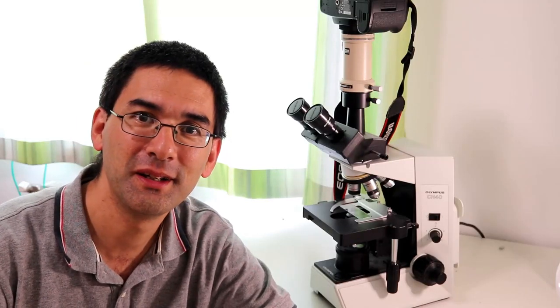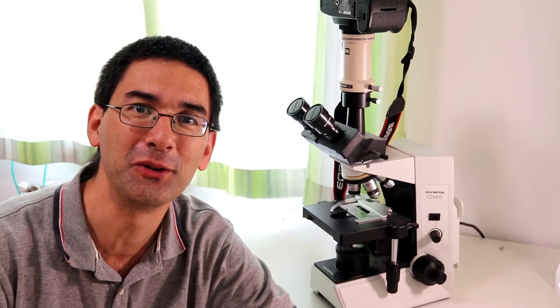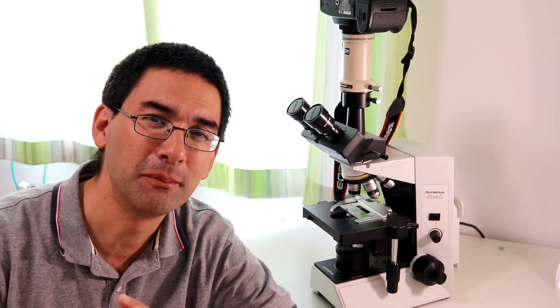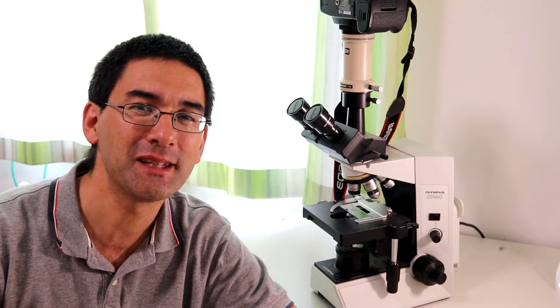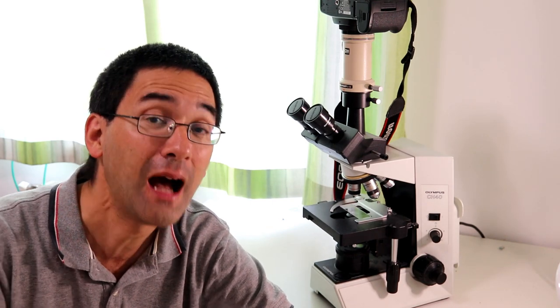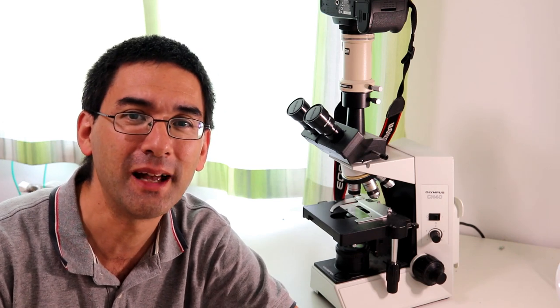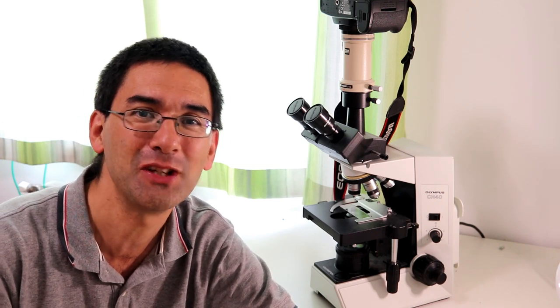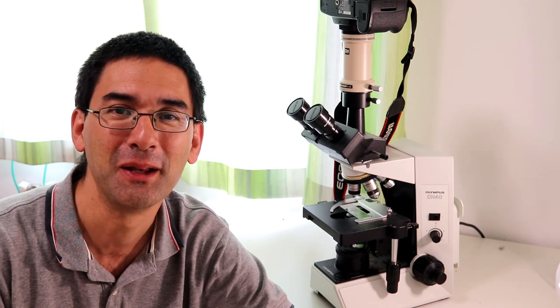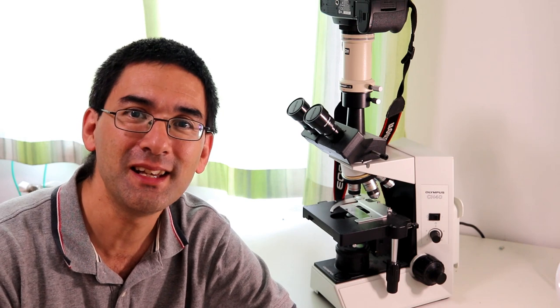Well, this was the insect project — it's one of those rare opportunities to use a stereo microscope. I have to admit the picture quality wasn't always the very best; I just held my camera in front of the eyepiece of the stereo microscope. A separate adapter would of course make things much easier and better. But I hope you still got a decent impression of how to use stereo microscopes. I want to wish you, as always, a nice day and happy microscopy!